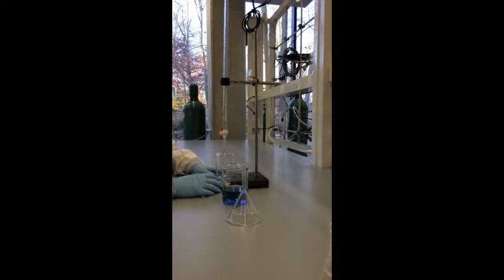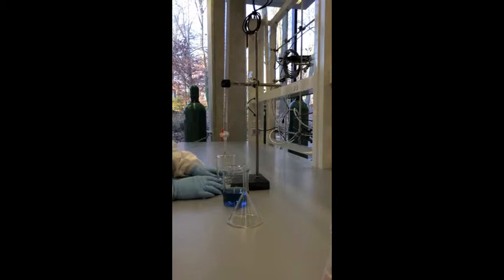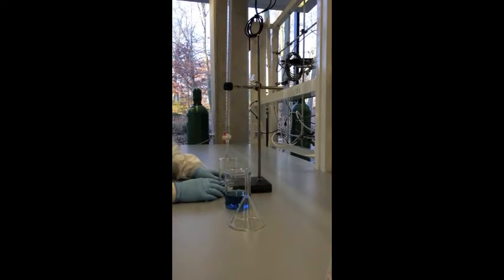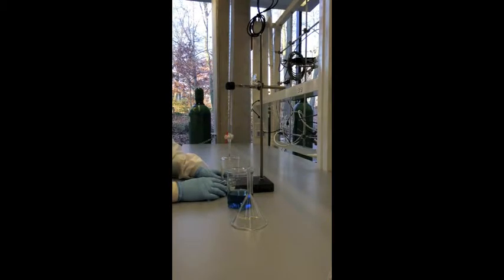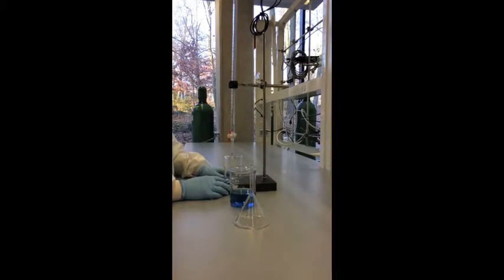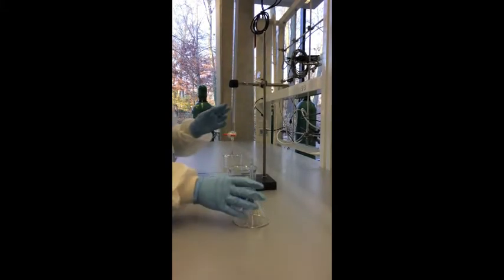A burette is used to deliver solution in precisely measured variable volumes. They are primarily used in acid-base titrations to deliver one reactant until a precise endpoint is reached. Before titrating, condition the burette with titrant solution and check that the burette is flowing freely. To condition the burette, rinse the inside of the burette with solution, then drain through the tip of the burette. Condition 2 or 3 times to make sure that the concentration of titrant is not changed by a stray drop of solution. To fill the burette, close the stopcock and fill using a funnel.